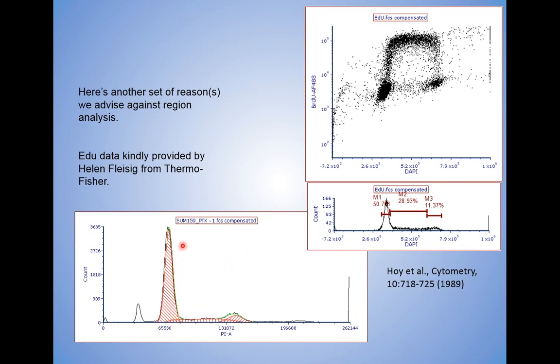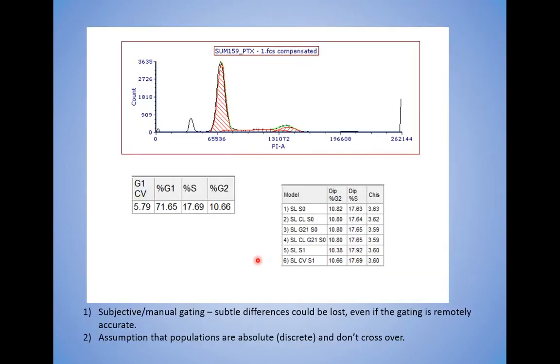In fact, the one file here again, that's Sum 159. You see the spill in here? Follow the red dot. That spill in here. This is S. There are guys here in S that are still going to be counted in G1, G0. That's these guys. Same thing for over here. That's the spill in over here. And you'll actually see a little bit of G1, G2M, and a little bit of spill from G1, G0, and that's fine. You've got these little guys over here. All right. Let the model do the work.